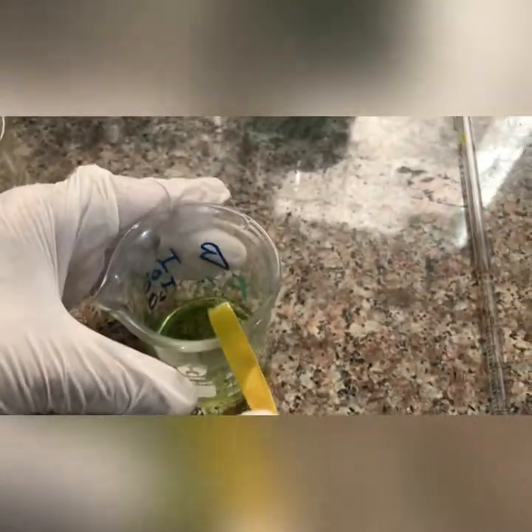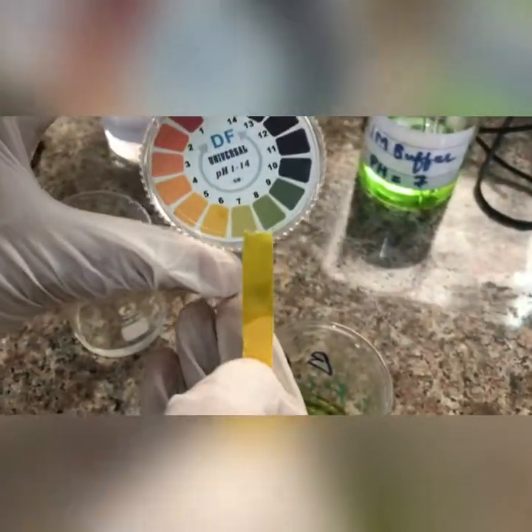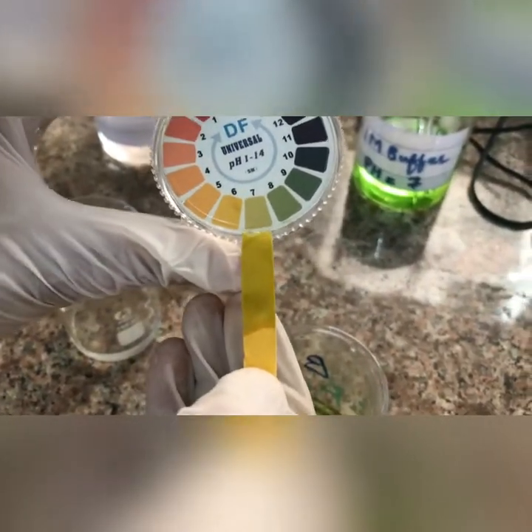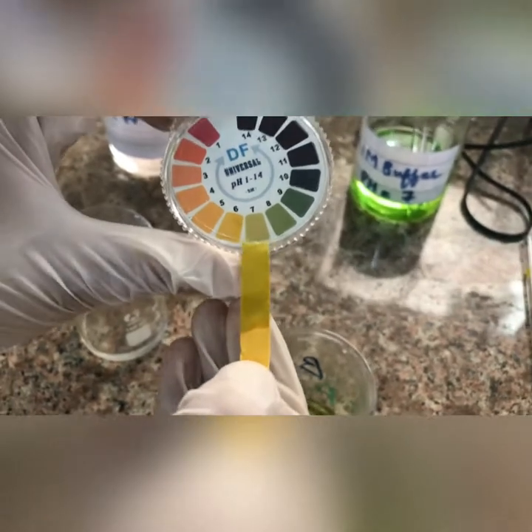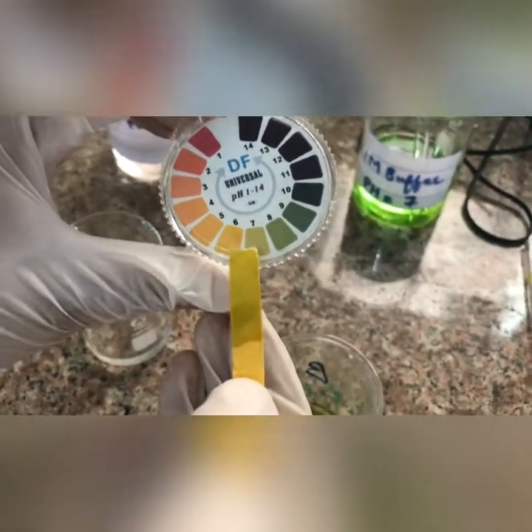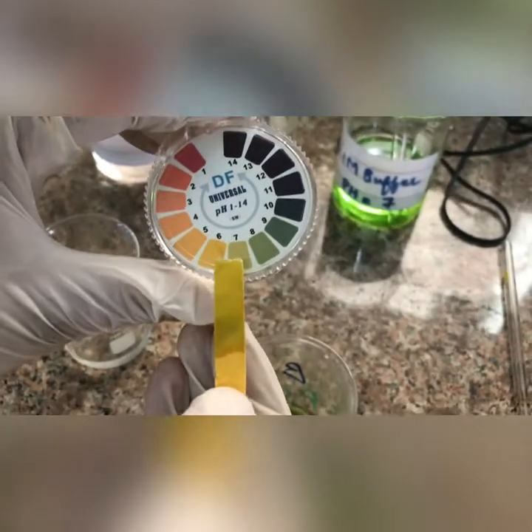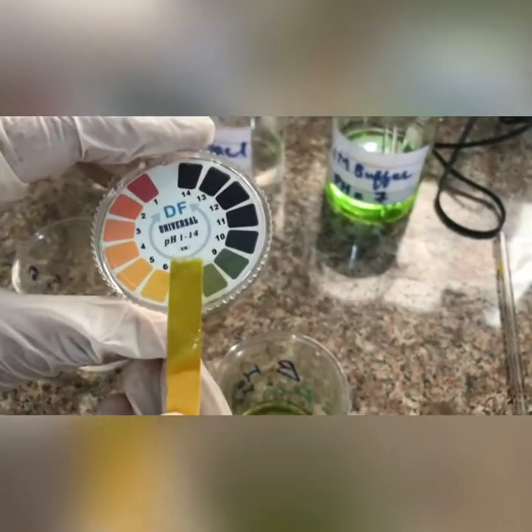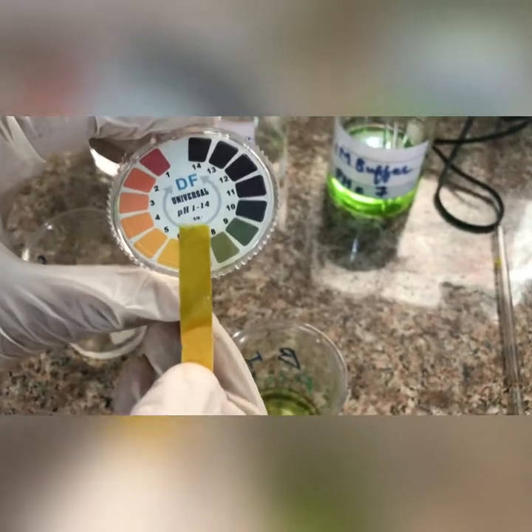The pH was known to be 7 before, and now it still shows 7 — it means no difference. This shows that the buffer will maintain its pH.